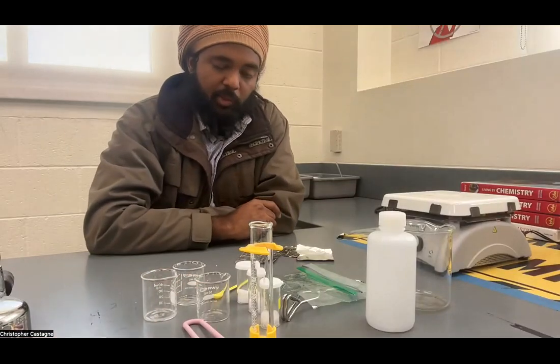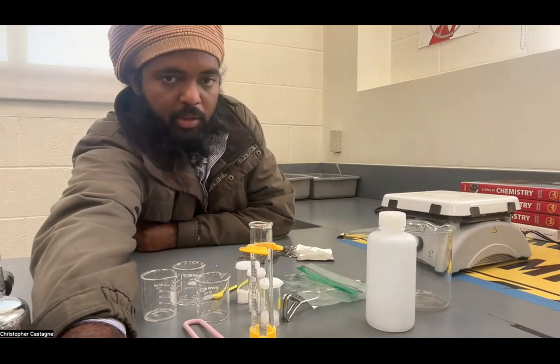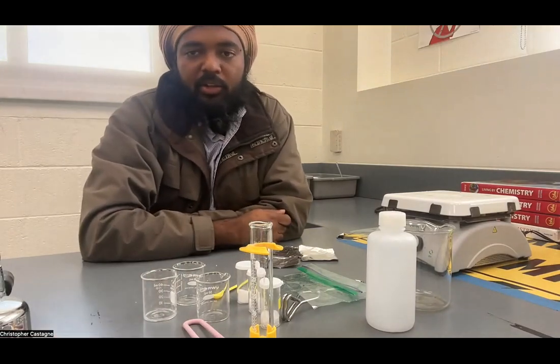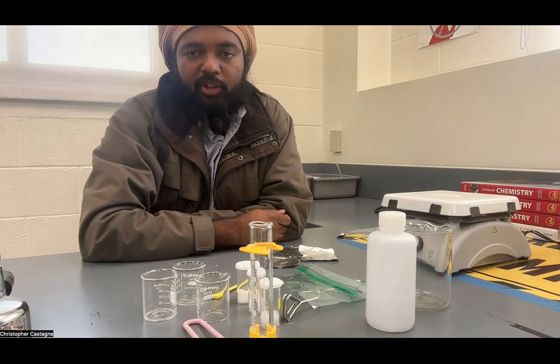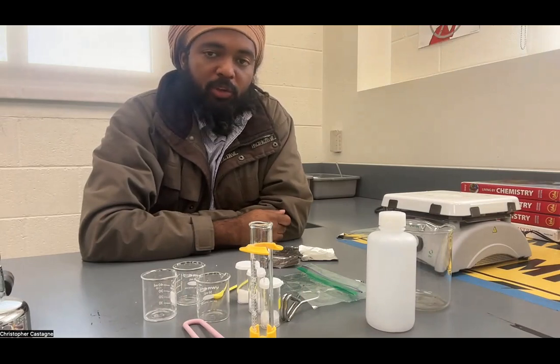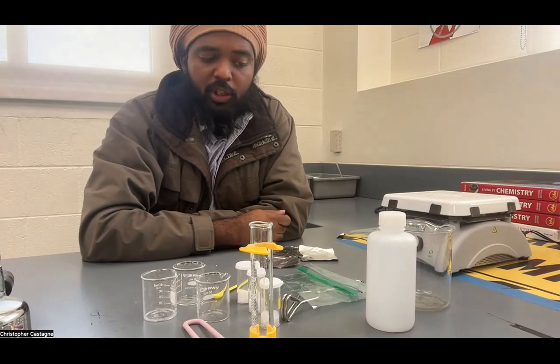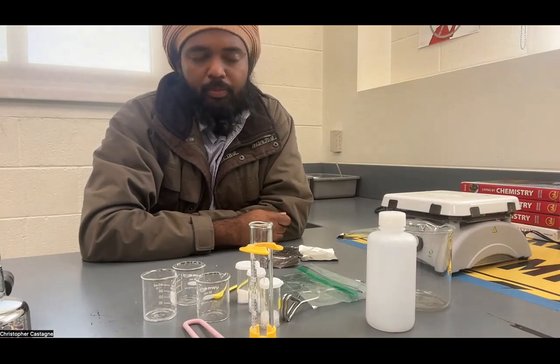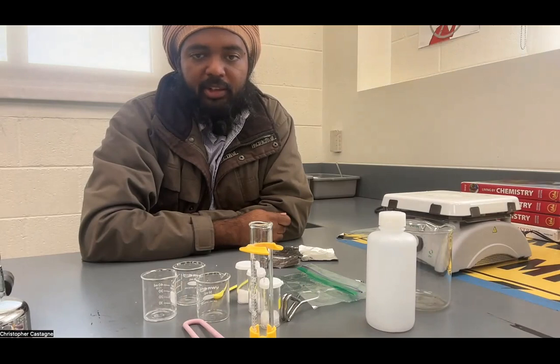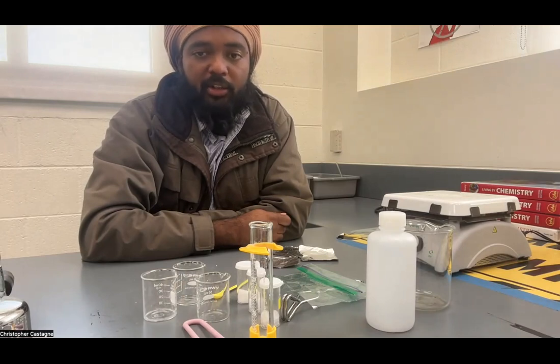Aloha, this is Raskas. I'm looking at lab 5.1a, called Inspector Ionic and Constable Covalent. This is a lab that I wrote and designed myself from scratch, reworking a couple of labs that investigate the properties of covalent and ionic solids.